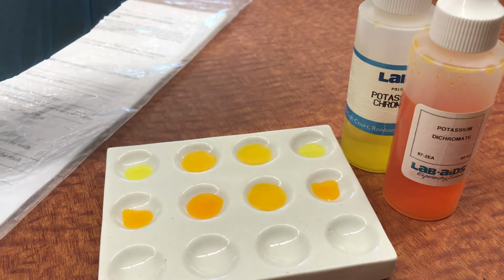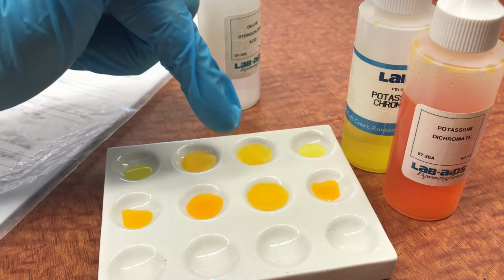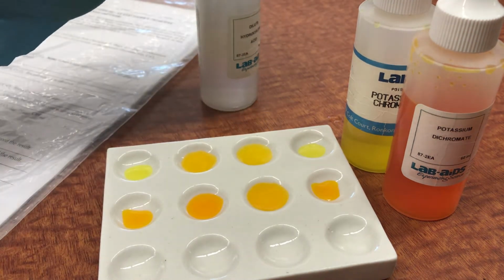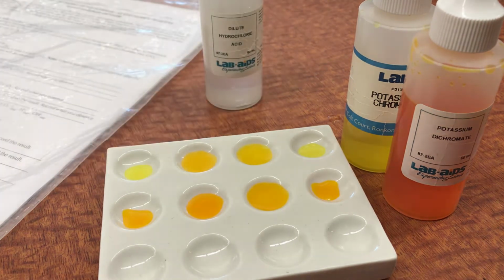And if you watch it very carefully, you'll notice that at the point where this touches, there's an instantaneous change, and then it spreads as equilibrium spreads across the solution. And it reaches the new equilibrium point, which has more of the orange or more of the yellow compound in it.